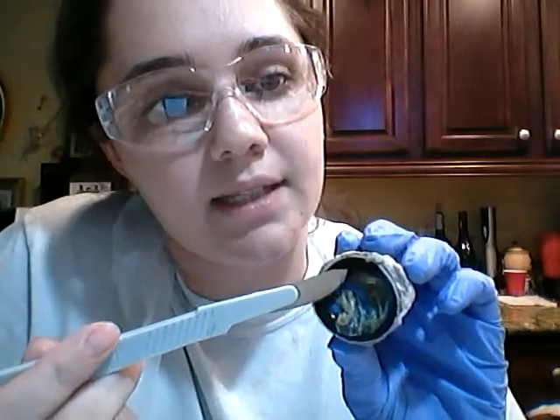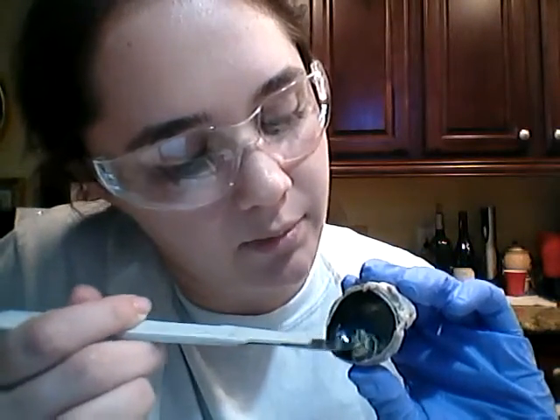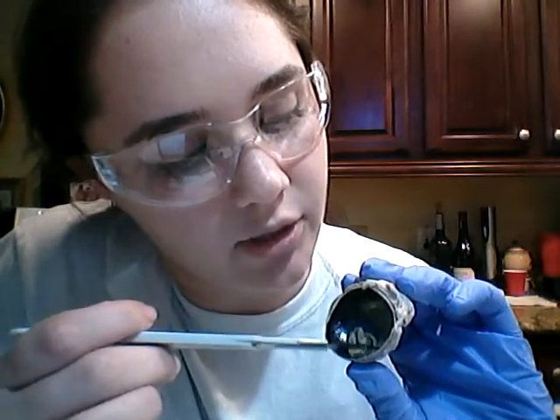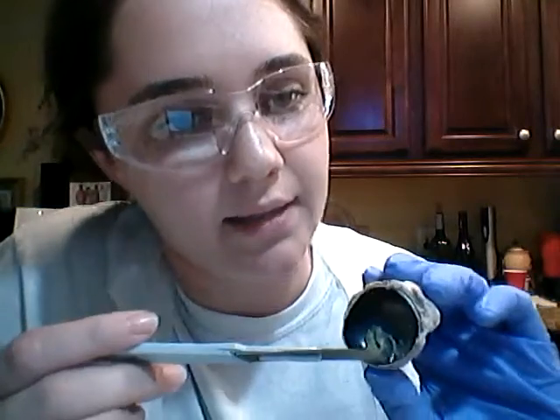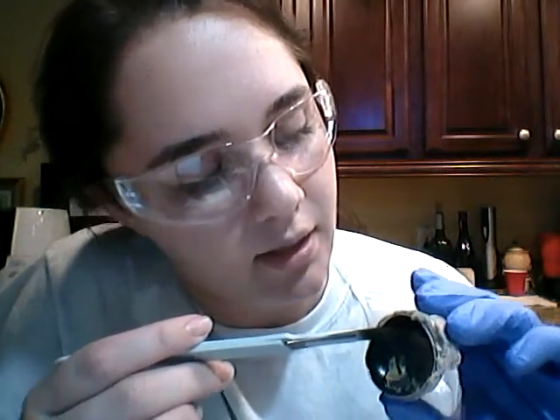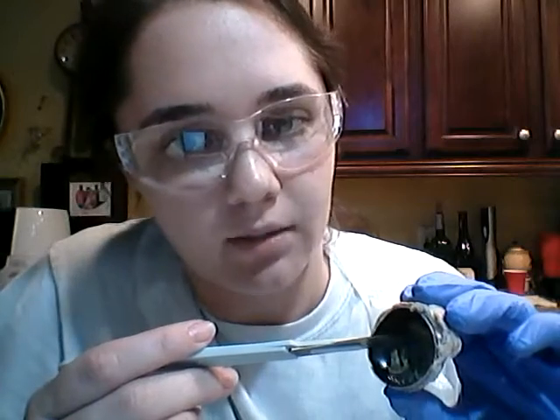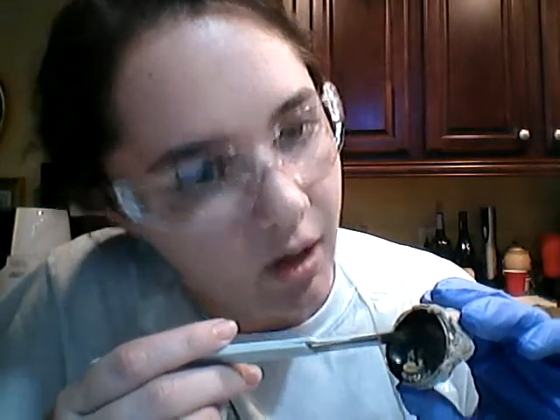This is the optic disc, and at the optic disc is where this little membrane-like structure, which is the retina, connects to here. So the optic disc, the retina, and the optic nerve all connect right here at this optic disc.